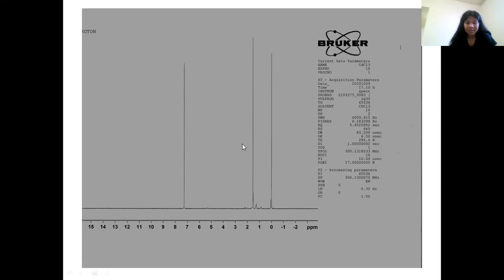Now suppose you have a compound with aromatic protons. This peak will definitely interfere with that. Suppose you have a structure with 6 aromatic protons and you get a cluster with 7 or even 8 aromatic protons. That means your structure can still be correct, because you have the characteristic 6 aromatic protons and the CHCl3 peak is included within that, so it just enhances the value. If you are not sure whether the peak is for your compound or for CDCl3, then you have to check the NMR in a different solvent so that this peak doesn't interfere.